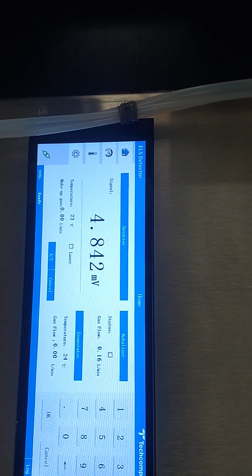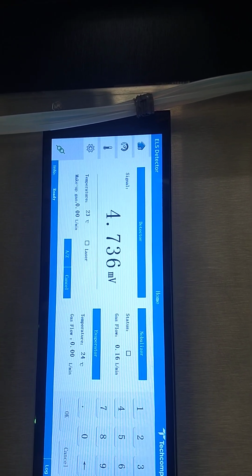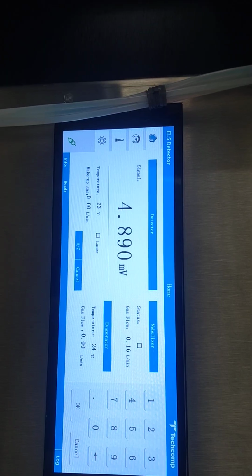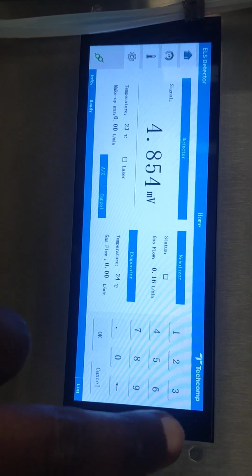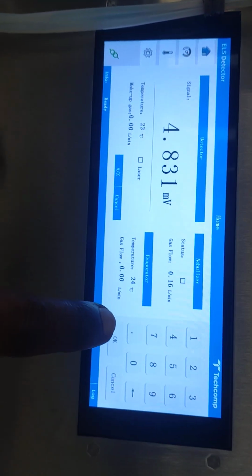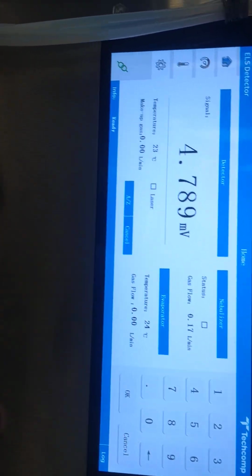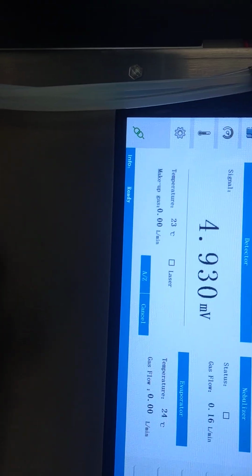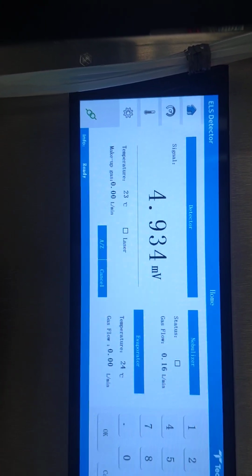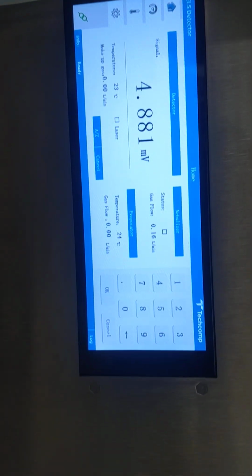Nothing is connected, and you can see the parameters of the ELSD detectors. We have to use the nebulizer, and for the detector we have to configure the signals, for example the wavelength, the temperature, the gas flow, and so on and so forth. For example, this is the gas flow that we have to insert normally by using these options, because it is a touch screen. If we want to use the gas, you have to insert the data by pressing this button because it is a touch screen.